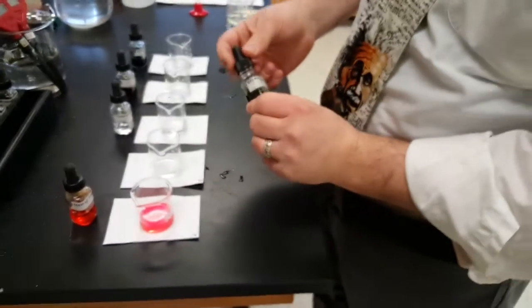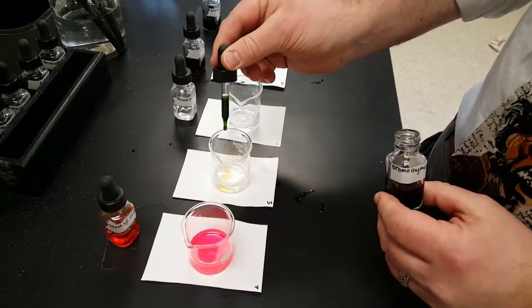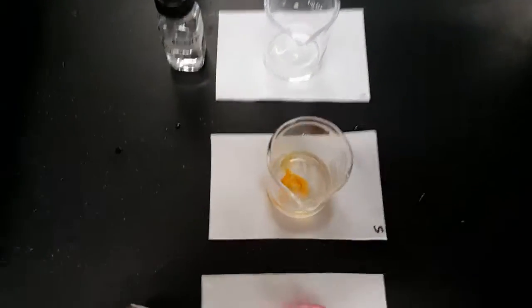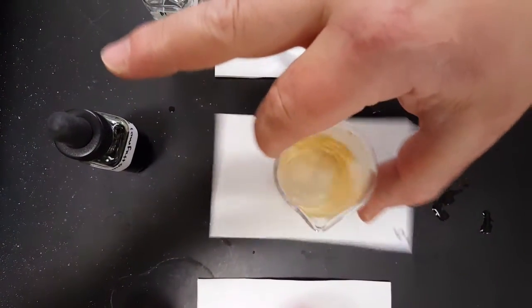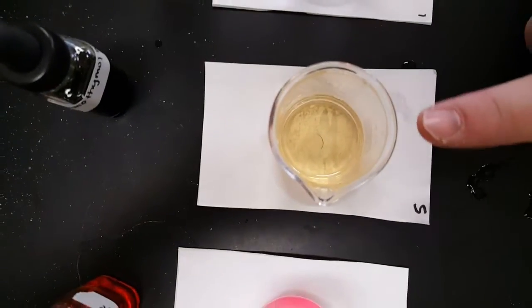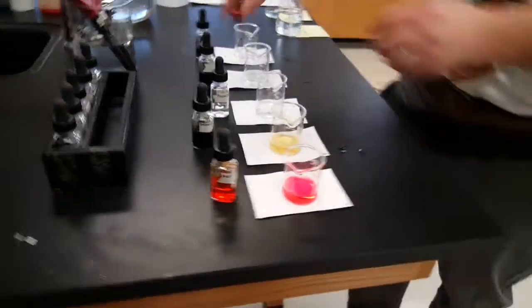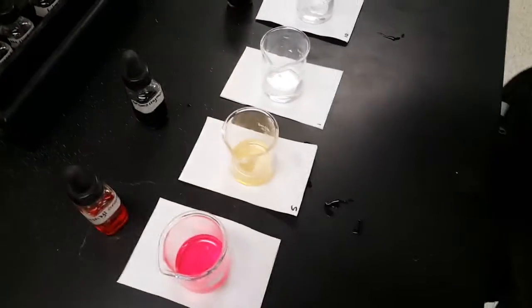So, the next one, for bromothymol blue, you have to put five drops in. 1, 2, 3, 4, 5. I'm the counter guy. And then give it a swirl. It's not homogeneous yet. Now it is. Notice this is a very light yellow. These color changes are subtle. I see colors. If you're looking for Crayola colors, you're not going to see them every time.